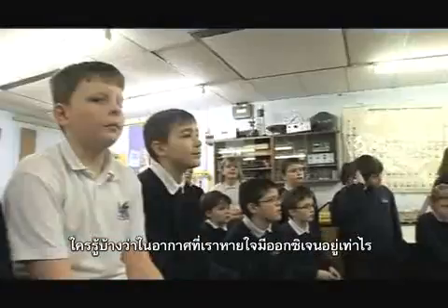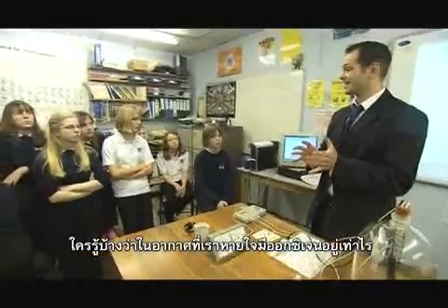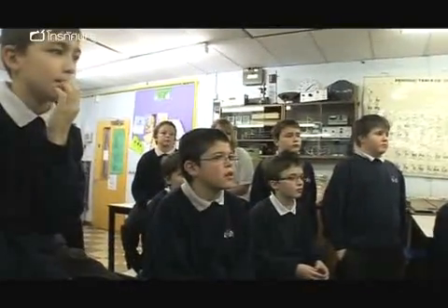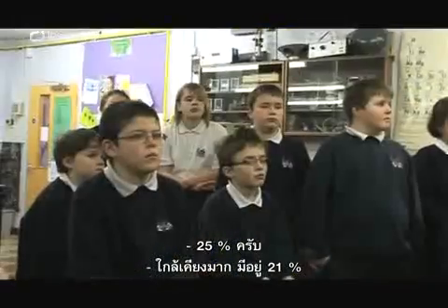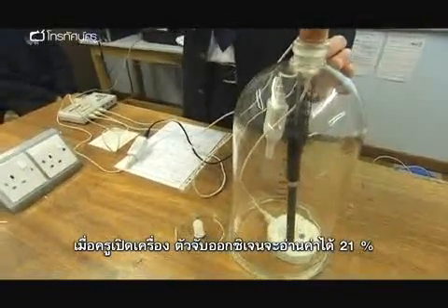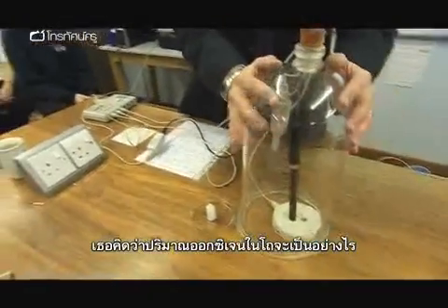Okay? Now, does anybody know how much oxygen is actually in the air we breathe? Zach? Is it 25%? You're not far off. It's actually 21%. So, when I start this off, the oxygen sensor is going to pick it up at 21%. What do you think is going to happen to the amount of oxygen inside this container?